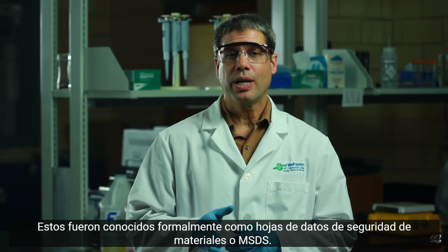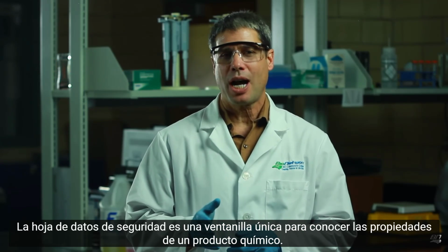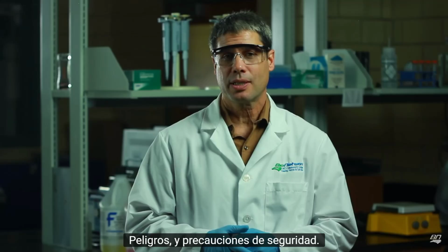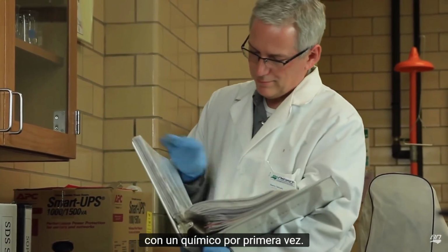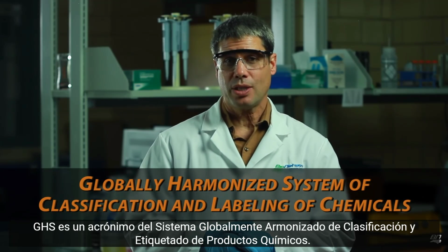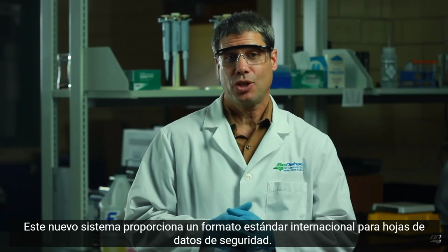These were formerly known as material safety data sheets, or MSDS. The safety data sheet is a one-stop shop to find out about a chemical's properties, hazards, and safety precautions. Know the location of the safety data sheets in your lab and review them before working with a chemical for the first time. GHS is an acronym for the Globally Harmonized System of Classification and Labeling of Chemicals. This new system provides an international standard format for safety data sheets.